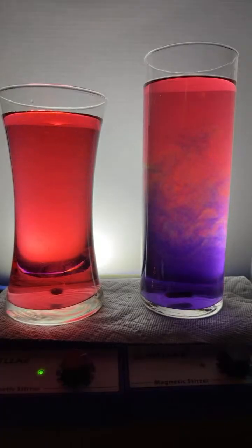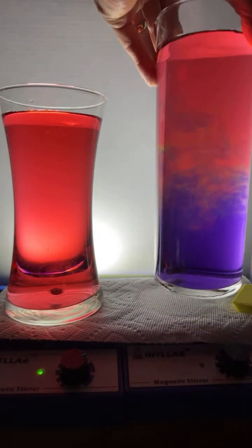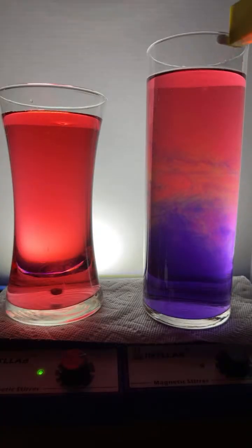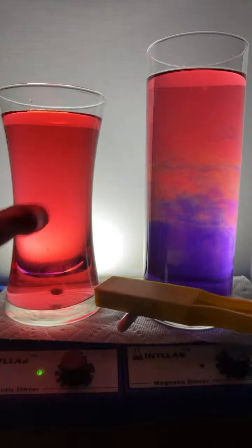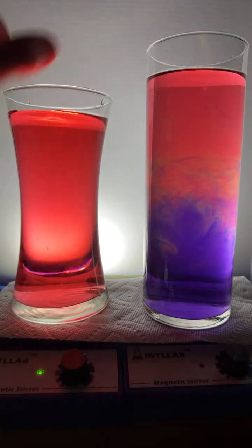What happens if you put the long stir bar in the short glass? Well, let's find out, all right? Let's do it. I don't know. Ah! I just lost a couple stir bars. Come here, buddy. Here we go. I missed it. No, I haven't. There it is. All right, so there's a long stir bar. Let's take this little one out. There we go. Put the little long one in there. Let me get this going.